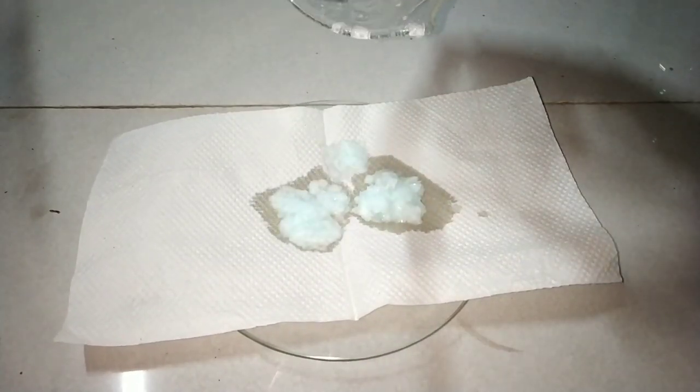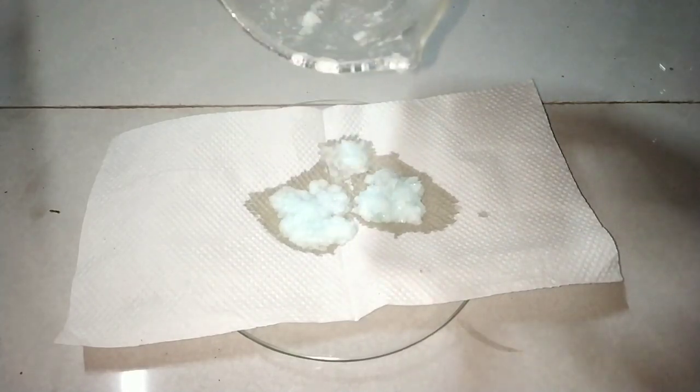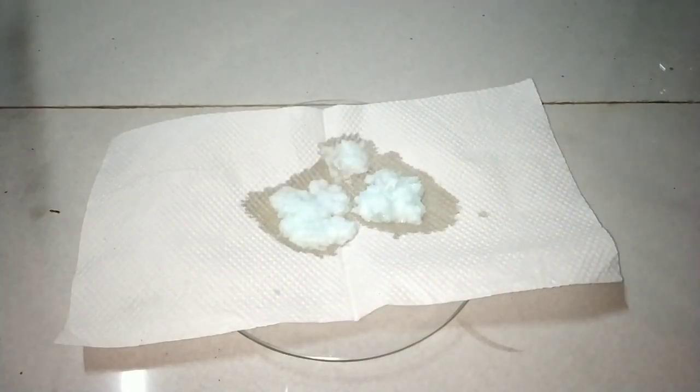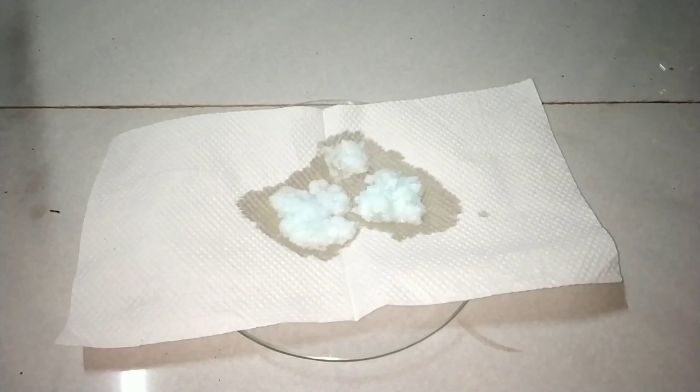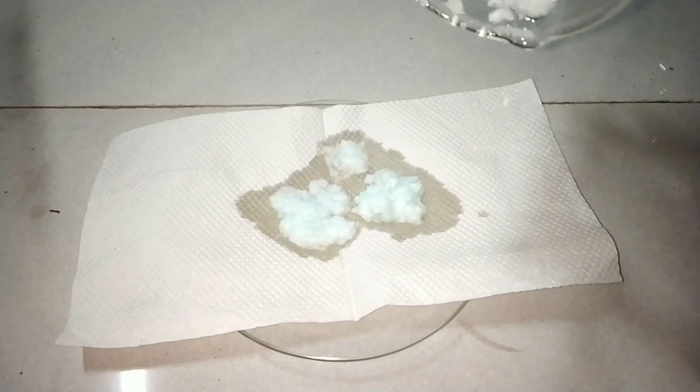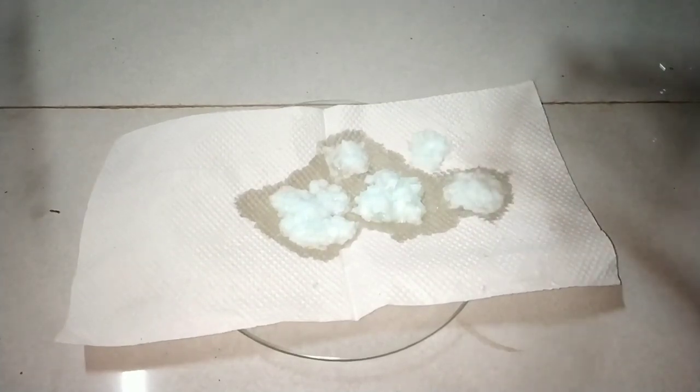And one thing to be noted is this is not a pure form of silver nitrate and you cannot get a good silver mirror with the Tollens test. So for that you will have to do the recrystallization procedure multiple number of times again.